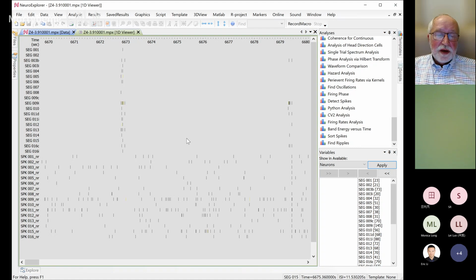If you see that all your spikes are corresponding to the artifacts, you may want to use this clean interval variable to detect spikes without artifacts. Then you can use those variables instead of segment variables.